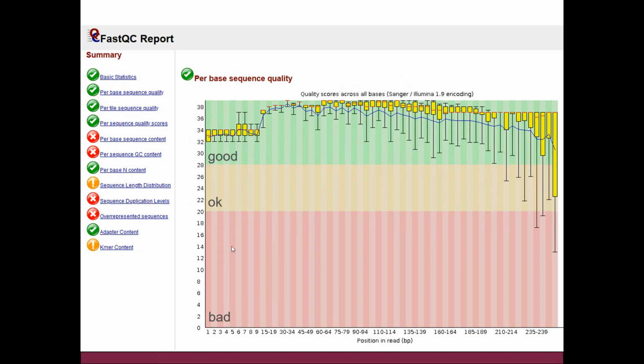So here we have the traditional quality plot from the FastQC tool. If you were running it individually, this is the kind of plot you would get. It is called per base sequence quality. And what you have here is, on the y-axis, the quality value, and on the x-axis the position in the read. So here we have the first position, the first base in all the reads you gave to the analysis, and the second base and third and so on.